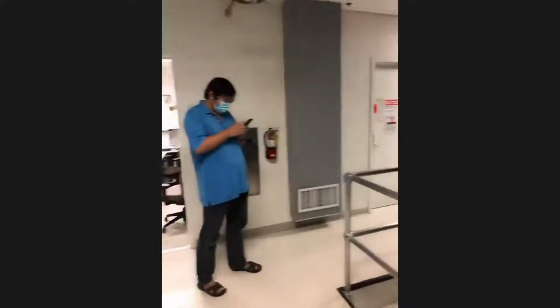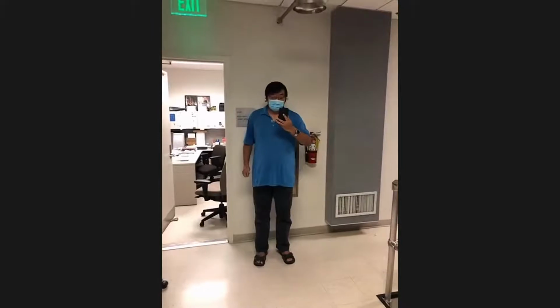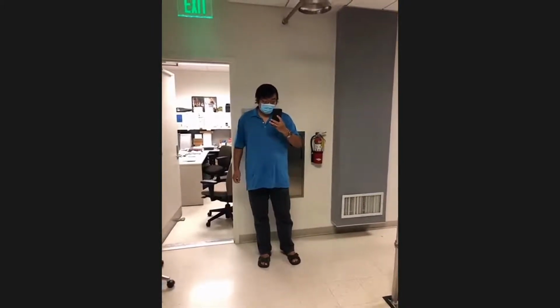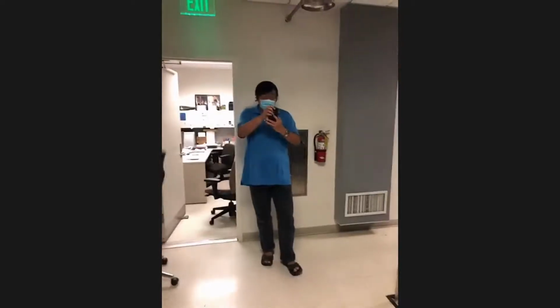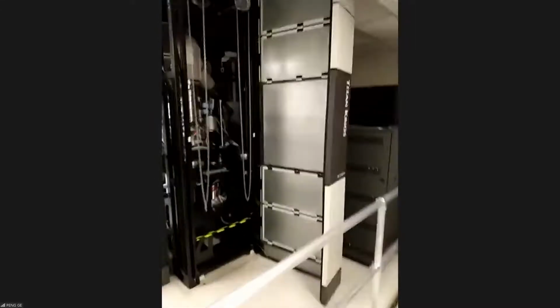And so with that, I'm going to turn it over to Dr. Peng, who's going to give us a little bit of a tour about the transmission electron microscope and its unique capabilities. Thank you, Adam. I'm Peng for the EICN facility here, and I'm glad to show you what we have for the electron microscopy.